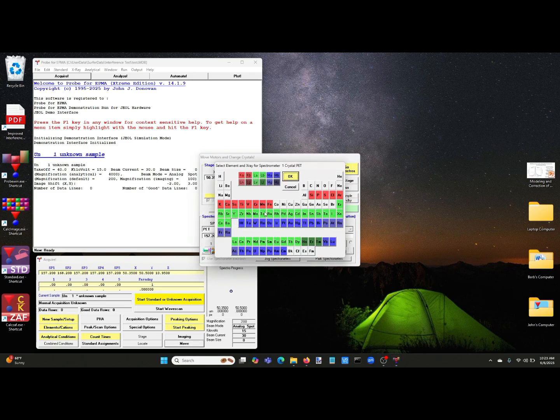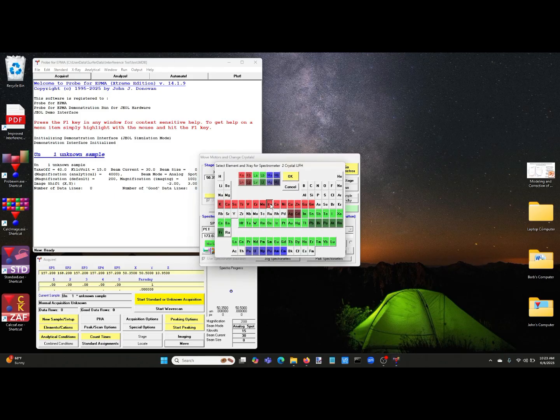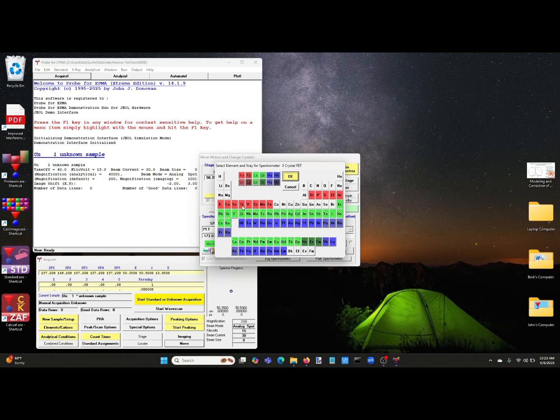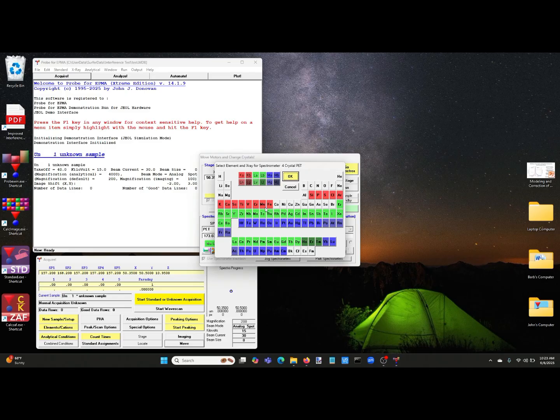We want to measure for molybdenum because that's the element that we're interested in this case. And we also may want to analyze iron. Let's say it's an iron sulfide that we're measuring molybdenum in. And then we also need to measure the sulfur. The reason for the sulfur measurement is because we need to analyze for not only the interfered element, but also the interfering element. And if we wanted to, say, do iron copper sulfides, we'd also add copper to that.